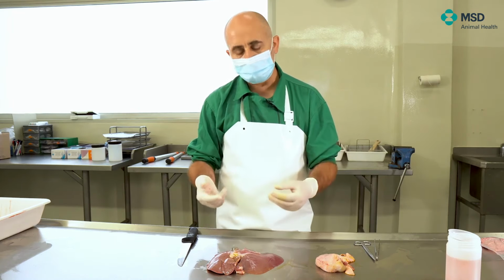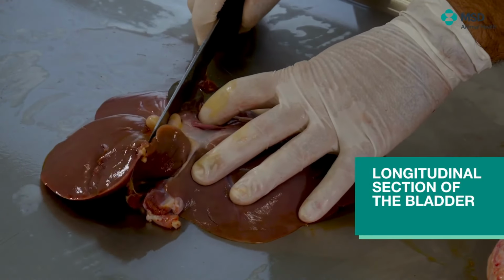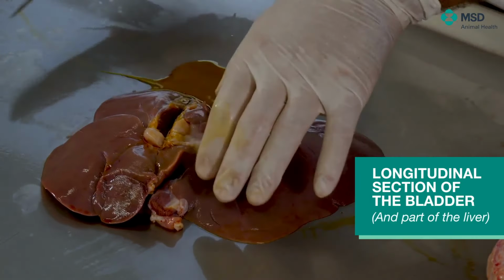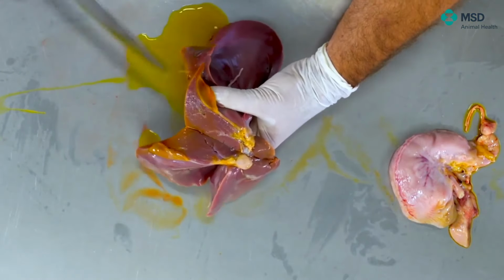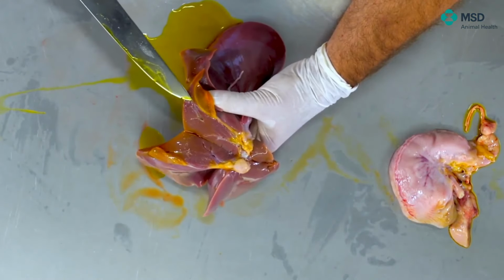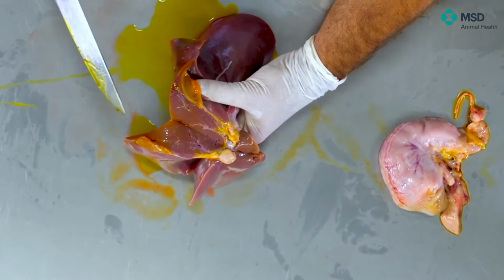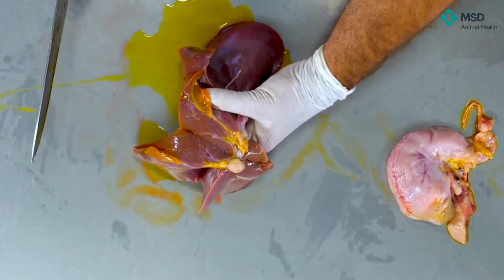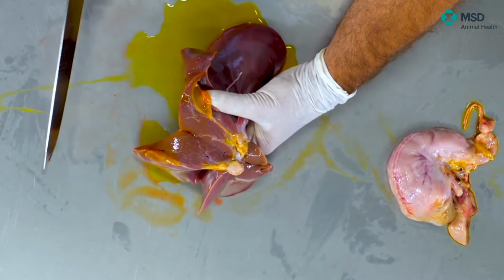The way of doing so is just with a knife, trying to cut, of course, once all the bile is gone, and then to analyze if in the wall, which is perfectly seen here, there is edema or not. Edema of the gallbladder is rather typical in situations of selenium and vitamin E deficiency, specifically in the form of hepatosis dietetica.